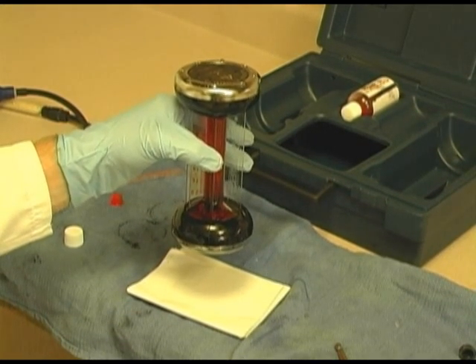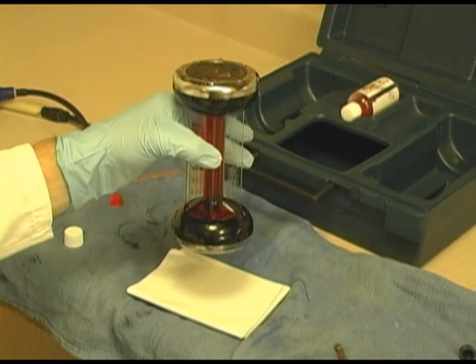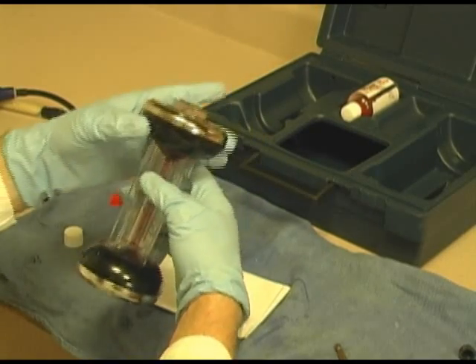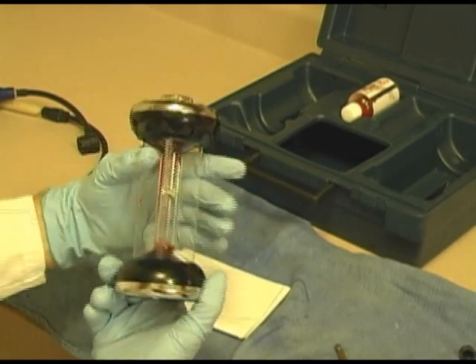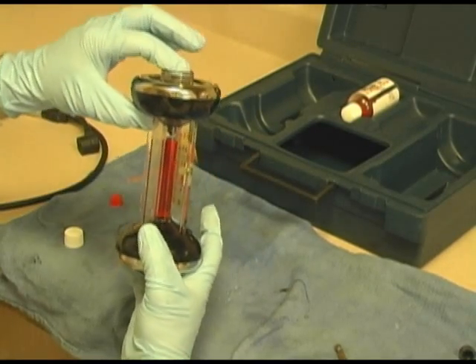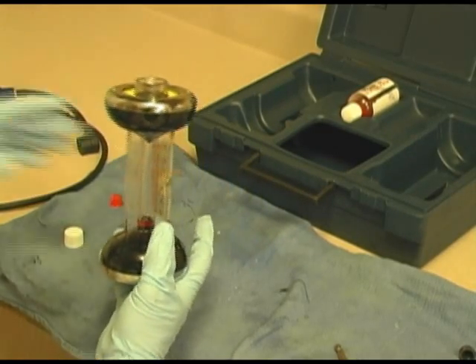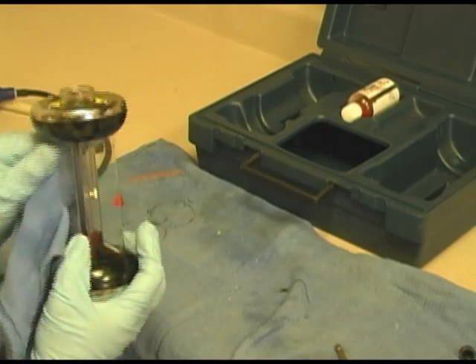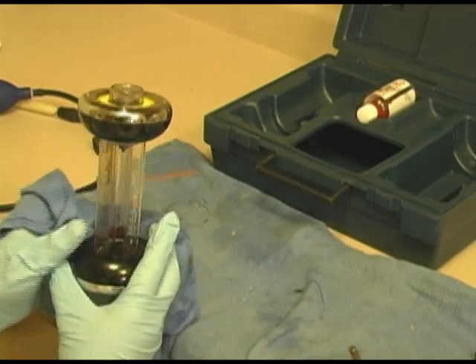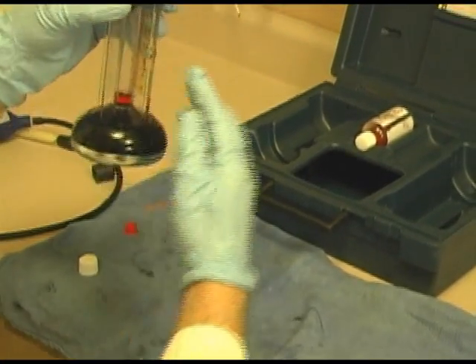Again, if you start getting drips from it, one way is to go back and make sure your plunger and all that is free of that salt solution and just clean it with distilled water. This should last me probably a year at least. We do our preventive maintenance every year. And now we are going to check them and see how accurate it is. I believe we covered this earlier, but we're going to do it anyway. First, I'm going to zero it.